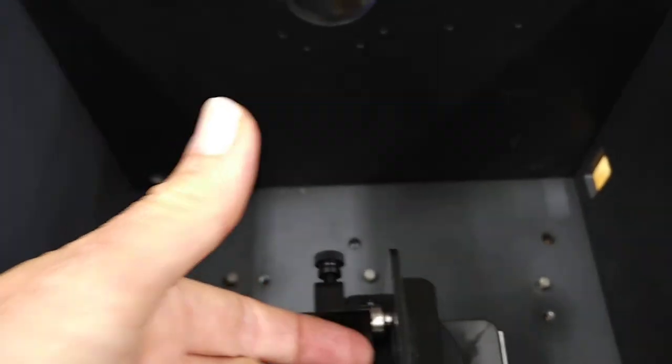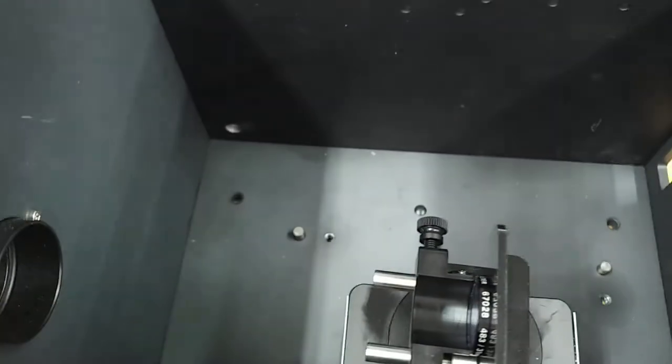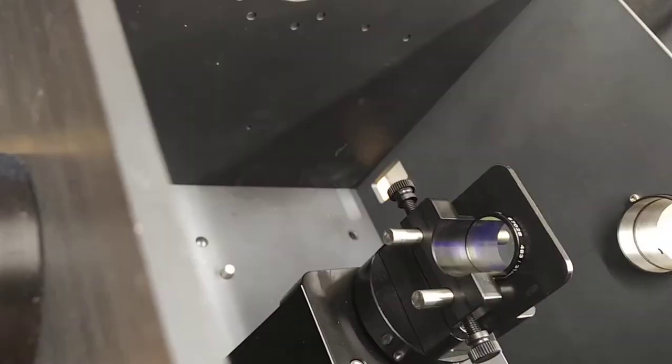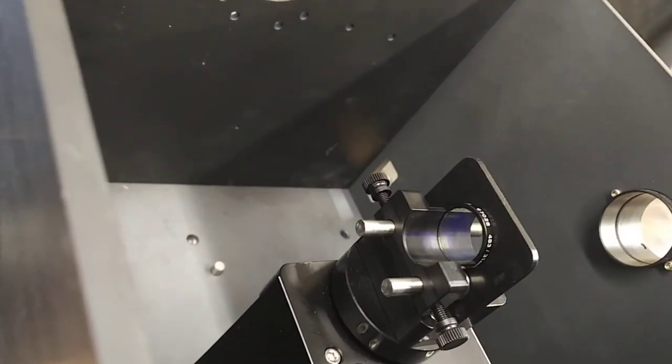And now we have a nice small filter sitting in place here, something that you might commonly use.